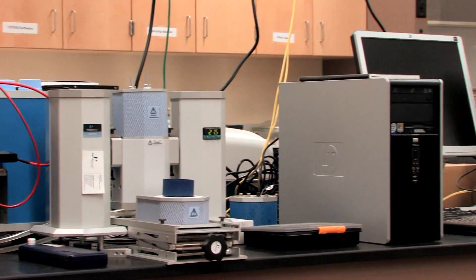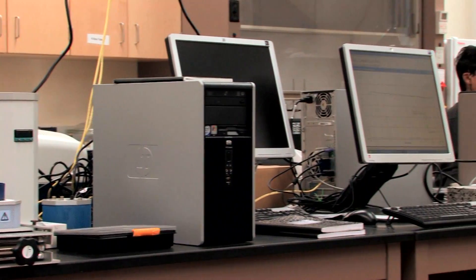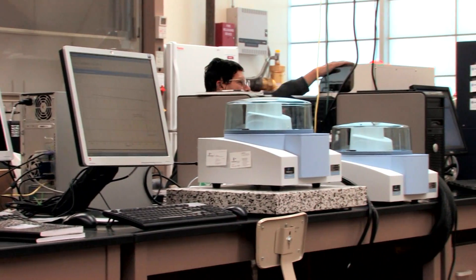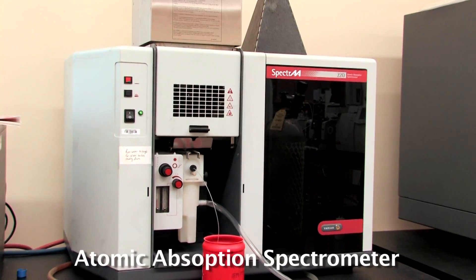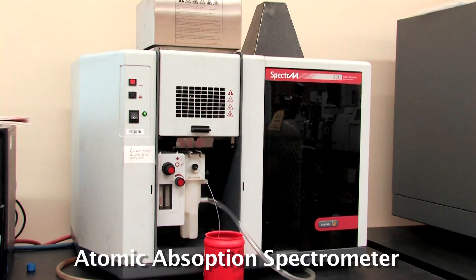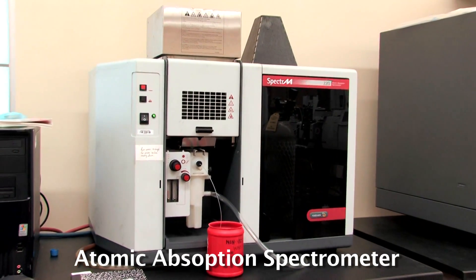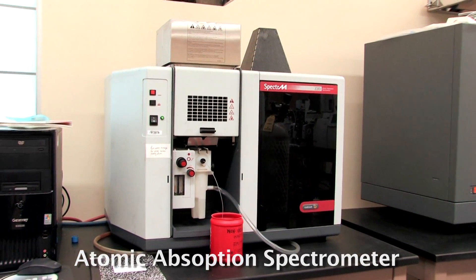Here at Northwest, we've got several different instruments that help us in elemental analysis. We have an atomic absorption spectrometer, which can analyze a single element at a time.